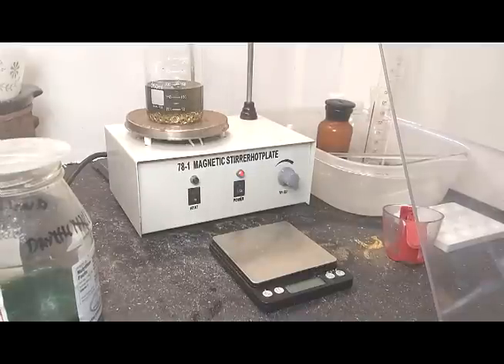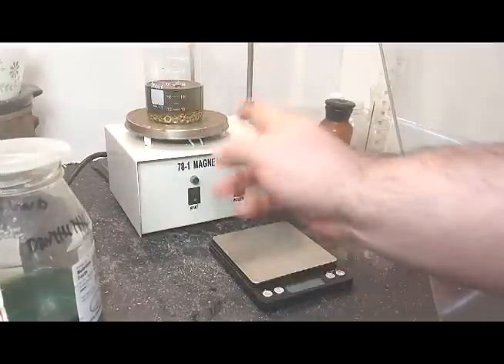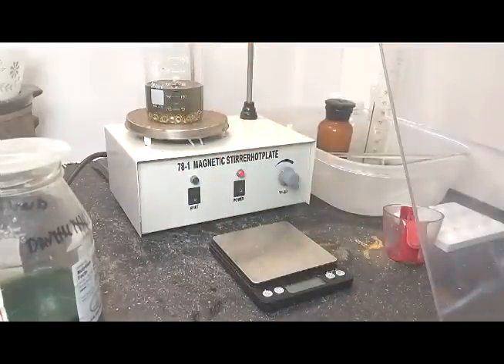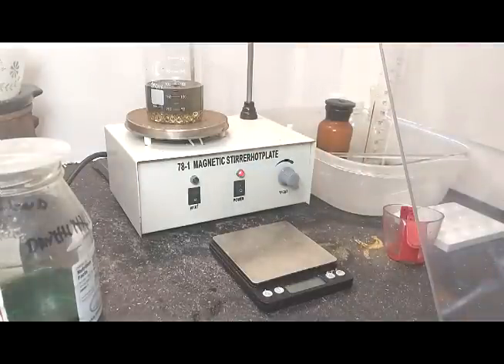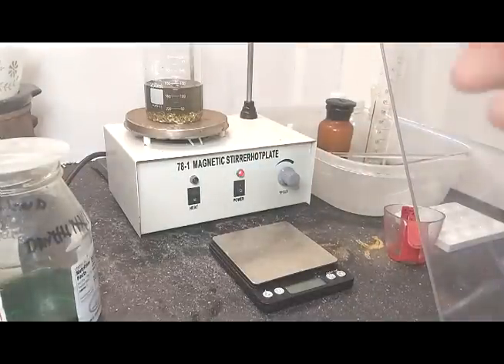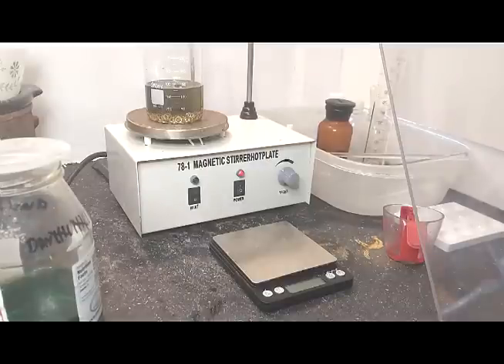This is the color that I would like to see. Chemically and scientifically, why is that? I can't tell you — I'm not smart enough. All I know is when I see this color, it's an indication that we do have dissolved base metals in solution, which means we have copper. Well, of course we've got copper — it's copper chloride in solution — but we're getting an excess of copper. I think there's going to be no iron in this because it was non-magnetic.